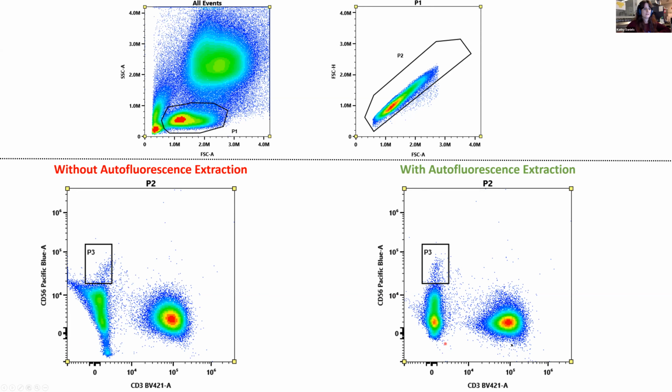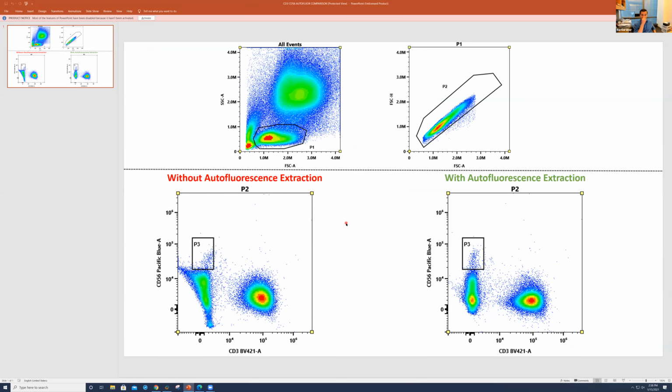Once you look at the autofluorescence extraction by checking that box and calculating the unmixing in that way, this is the same exact data file with the autofluorescence extraction. So we know it's quick, but we just wanted to show how easy it is to utilize that function in the software and how it can compare when you're looking at the same data file with and without autofluorescence extraction, especially on a combination that we know has a high similarity index, with Pacific Blue and BV421, right? So it was quick, but that is a very good example for today.